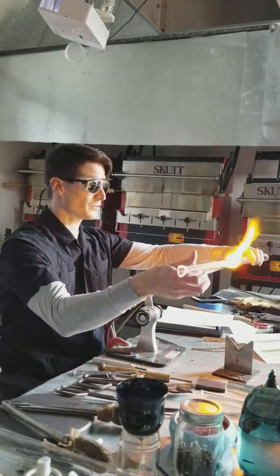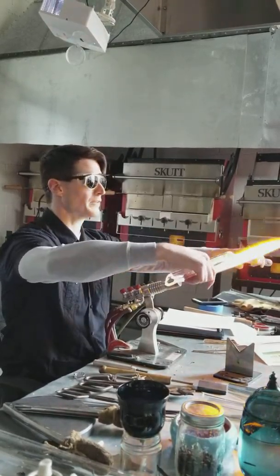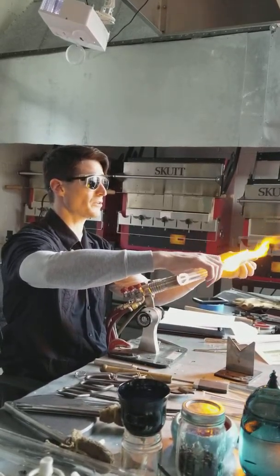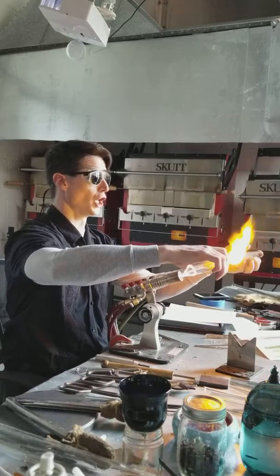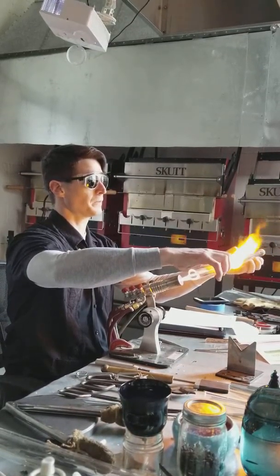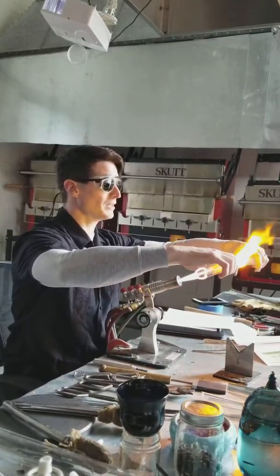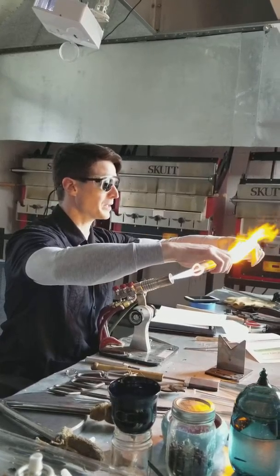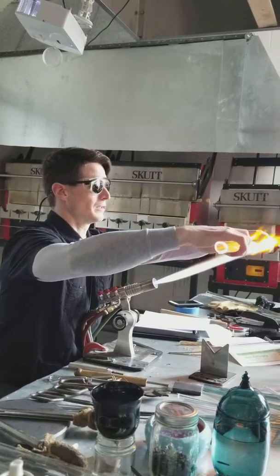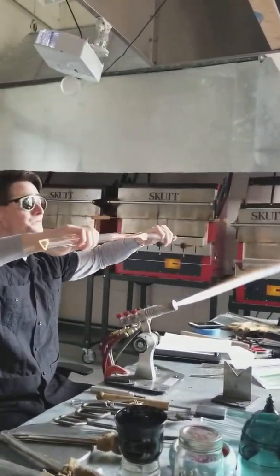As well as the exterior — people like to cut that short and not give it the proper amount of time, because it starts to move like a liquid and they freak out. Their hands don't know how to control it and they prematurely pull, then they get this lumpy thing. You've got to work at the edge of the flame heat that allows you to stay in and be comfortable. If I back out I'm softer and slower. It's a lot easier — so I back out of the flame so I don't get a hot spot, and I pull.